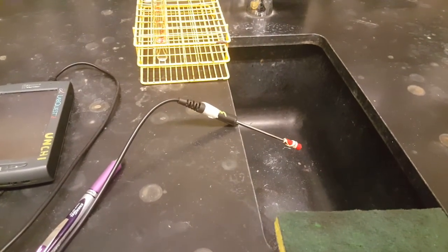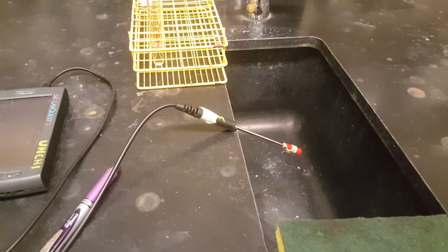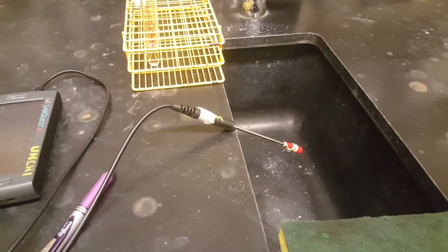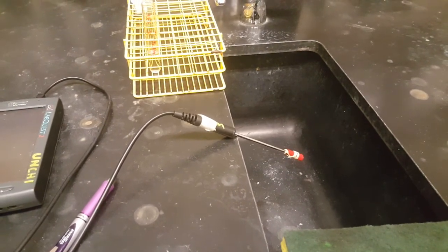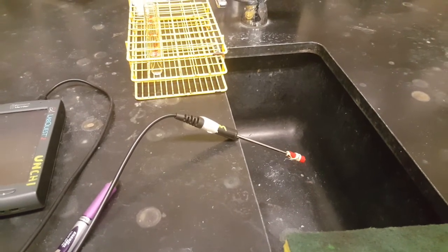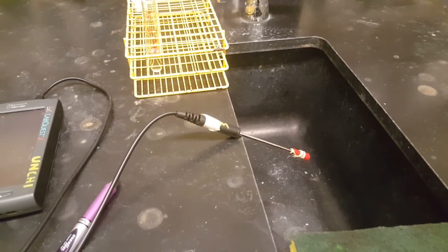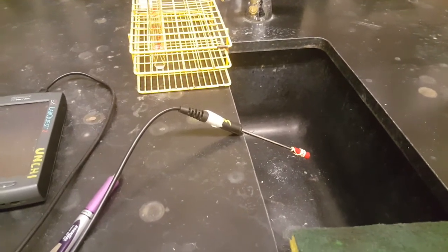While we're waiting for the data to flatline, I just wanted to give you another perspective of your thermoprobe and how it's angled into the sink. The reason we did this is to keep the air that's moving around in the room, because we've got the ventilation on, because we have alcohol solvents in the air. We want to keep the air from blowing on the thermometer too much and accelerating the rate of evaporation. So I'm trying to protect it down here in this well.